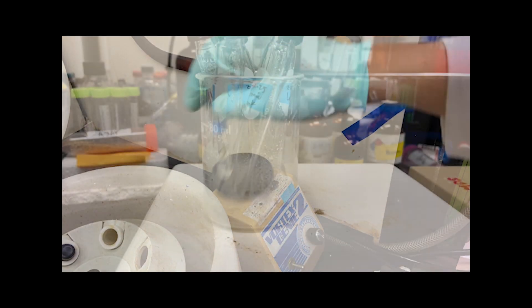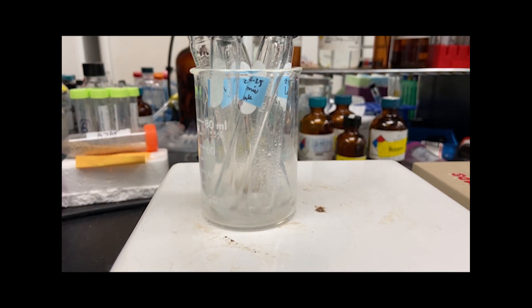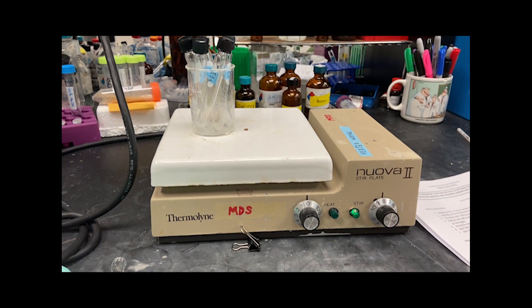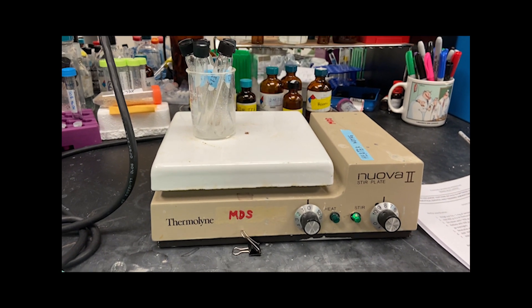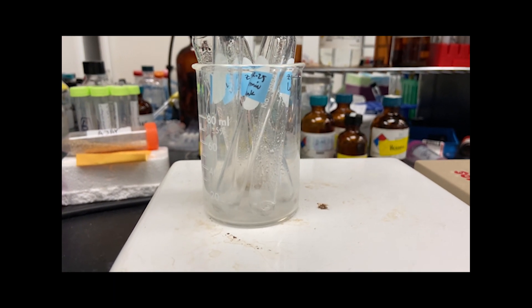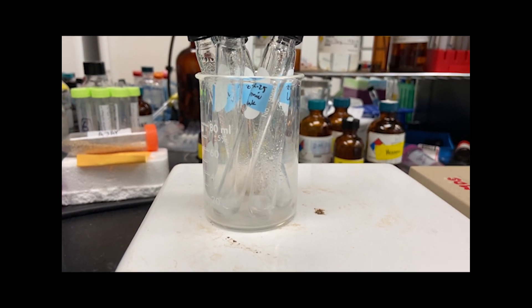Before we add our sodium hydroxide base to the sample, the sample is dissolved in 400 microliters of DMSO. This is spun magnetically using spin vanes which should sit for at least 30 minutes prior to beginning the experiment. The sample can spin for longer though, even a week before beginning to really try to dissolve the sample as much as possible.